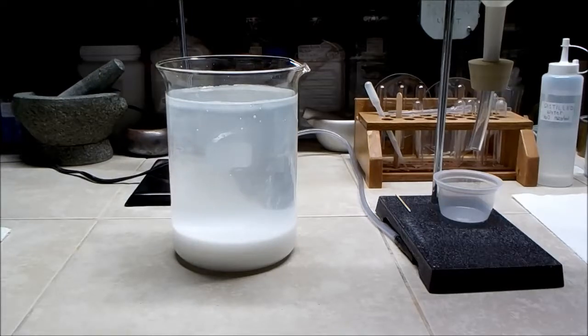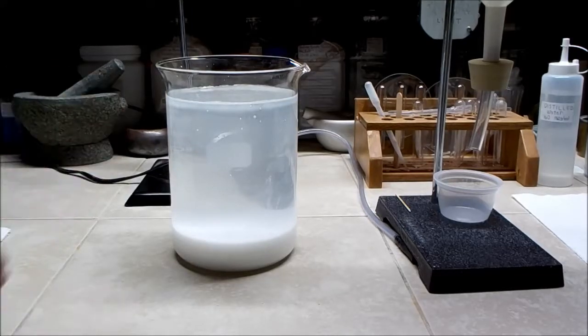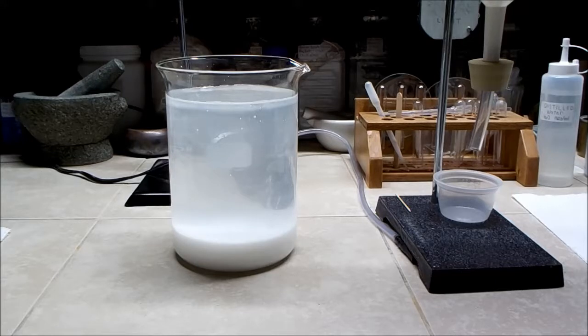So it's about three hours later and that has settled down quite nicely, so I will try and decant it off as much as I can.